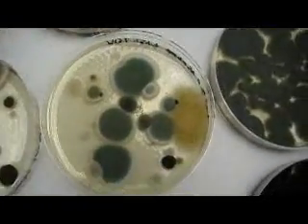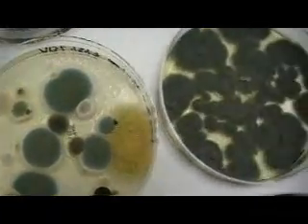Most of these images we are seeing here, they are from air samples which people have sent to our lab, and then we capture that air in media, and we end up with these types of different moulds. Some of them look black, as you can see.